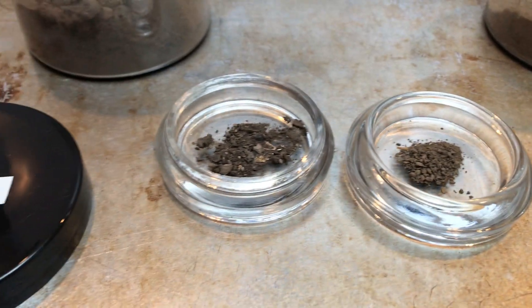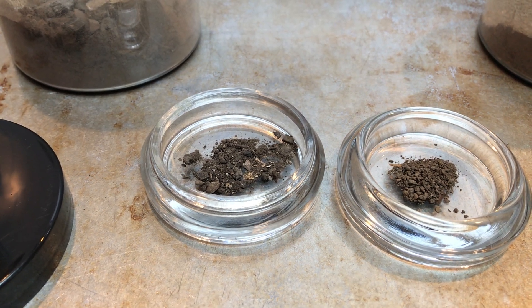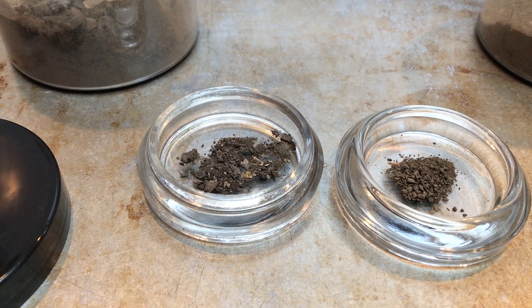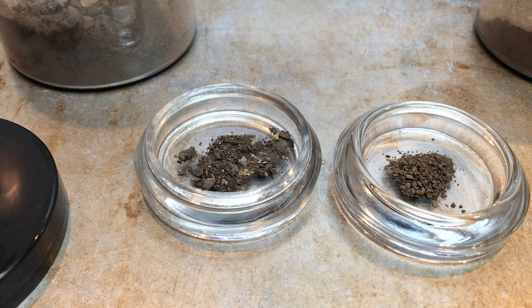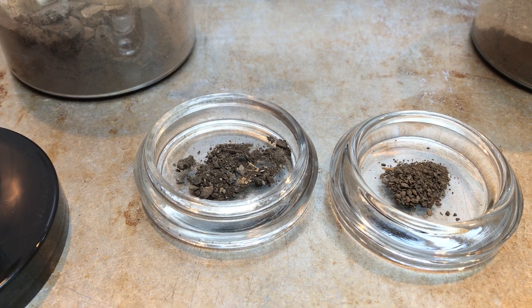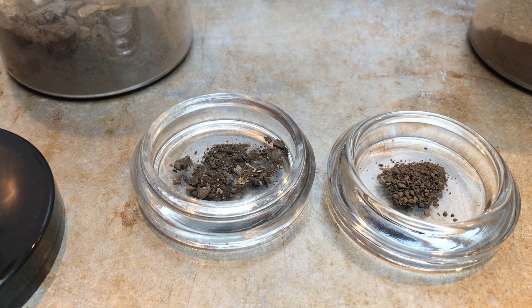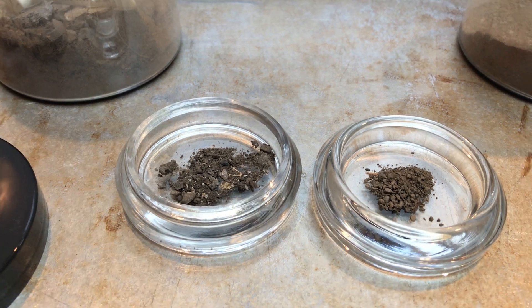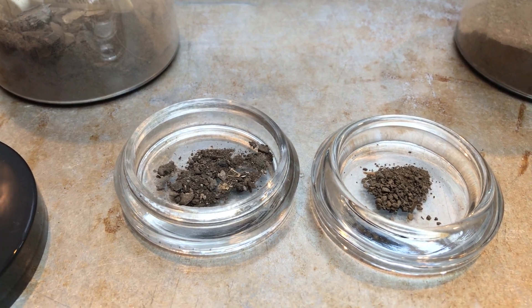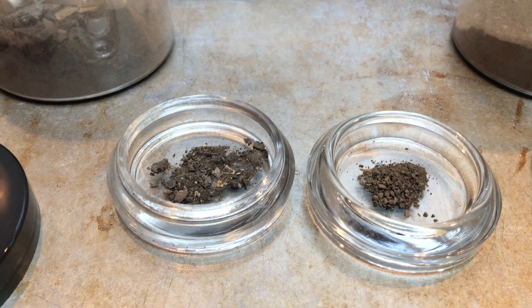My assistant Bridget is going to be placing several drops of hydrochloric acid on each one and we're going to be observing the results. Remember, if we see a fizzing reaction, the soil sample is positive for calcite. If we do not see a fizzing reaction, the soil sample is negative for calcite.